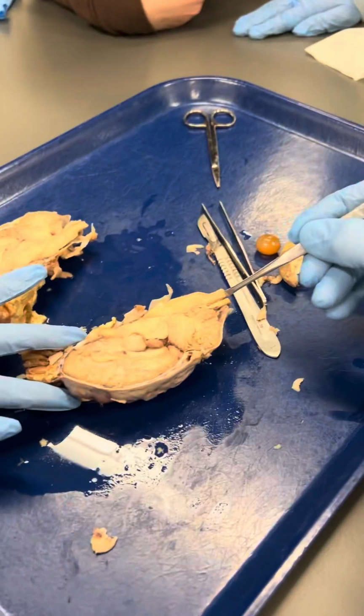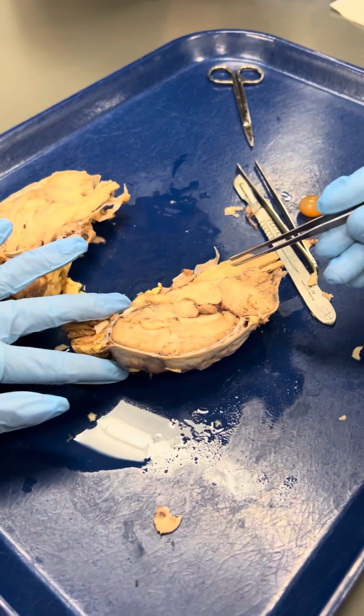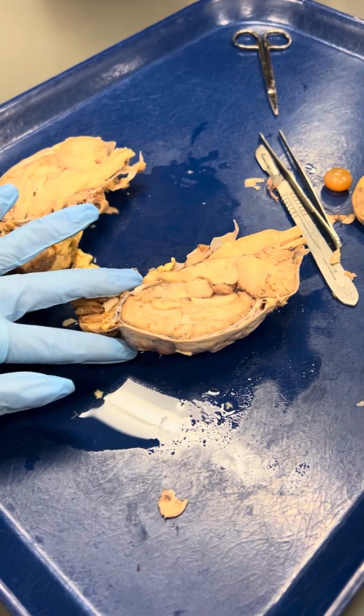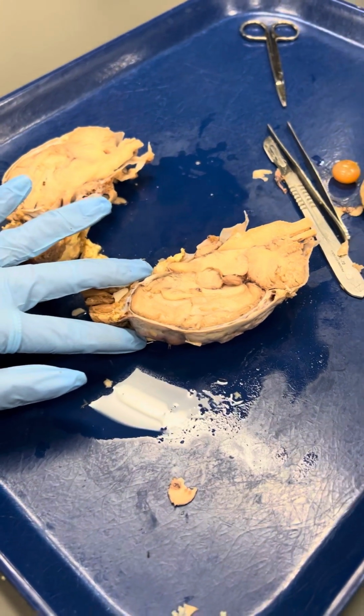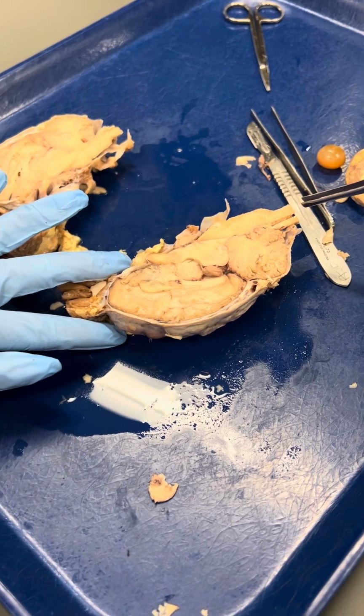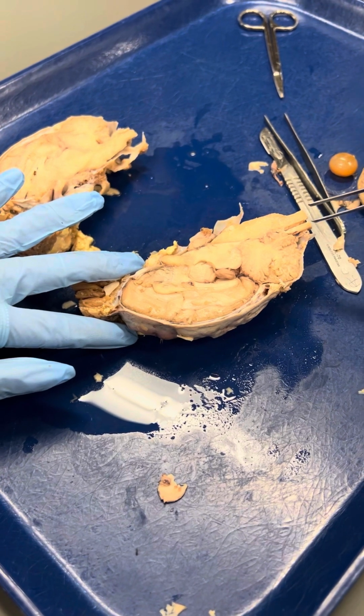Here, going into the spinal cord on out. I can't tell you, on this specimen, it's hard to see like pons, medulla, start of the spinal cord. So that's this region. Any of those names would be fine for me.